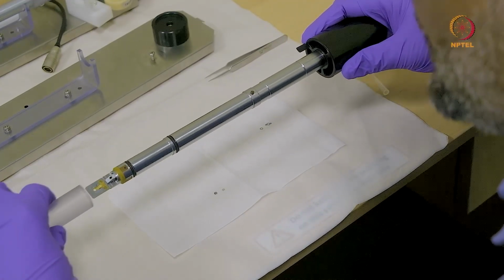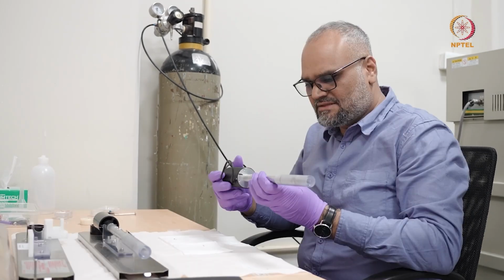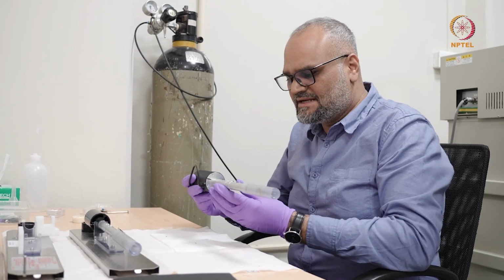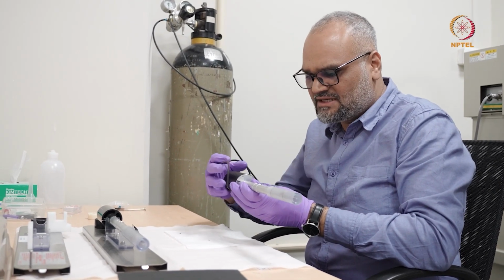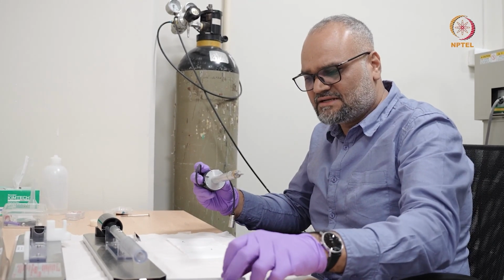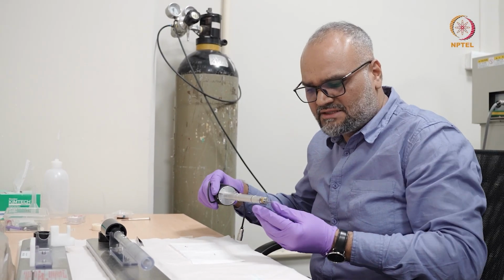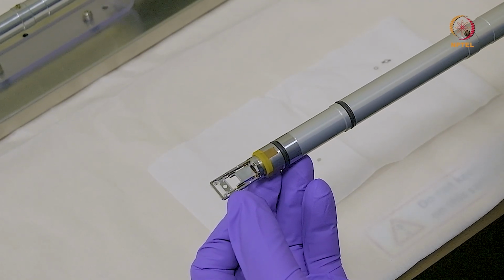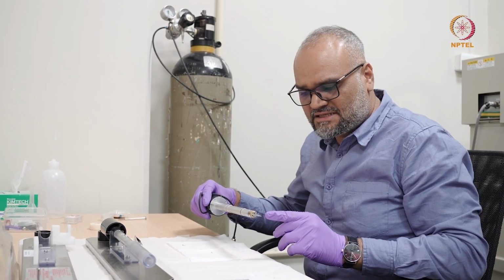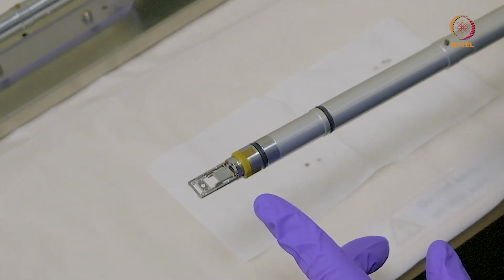And the other kind of a holder that we typically use is the following. So here is a standard double tilt holder. The idea is you have a small motor inside which applies the secondary tilt. So the primary tilt or the first tilt, like the previous holder, is along the axis of the holder. And when I do the double tilt, this actually goes into the cradle here. When I do the secondary tilt, the cradle that you see here is actually tilted. Connect this to the goniometer here and then see how the tilt happens.